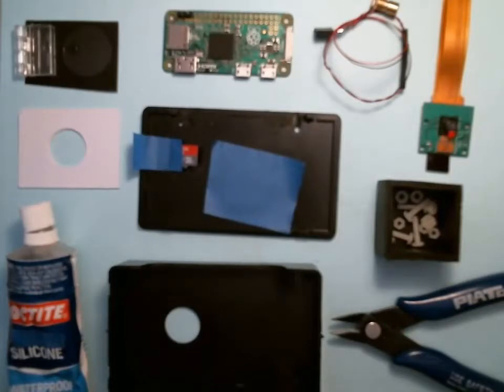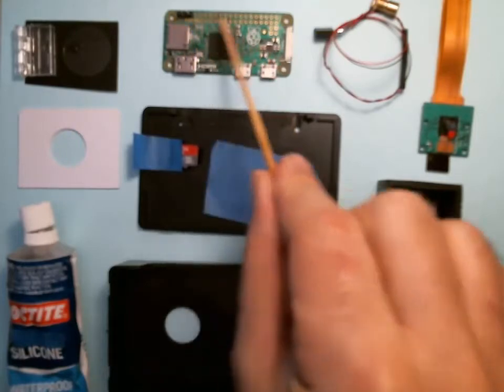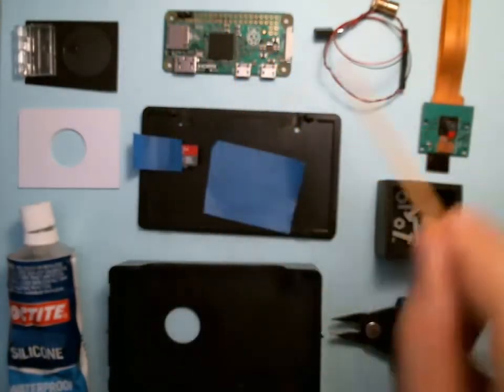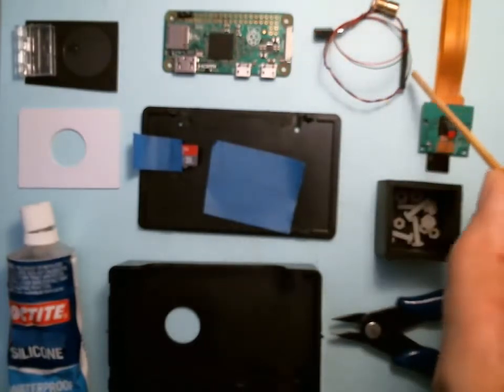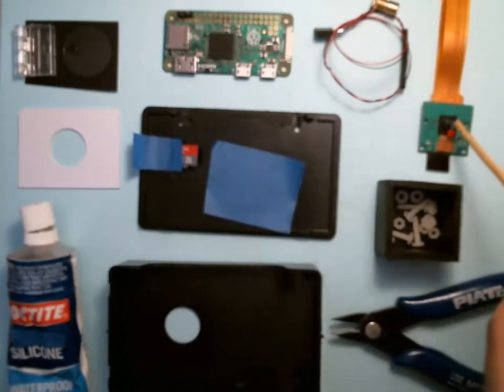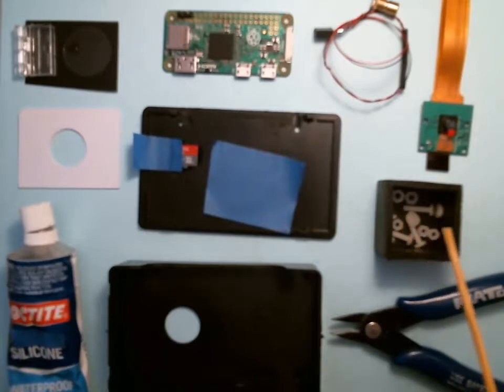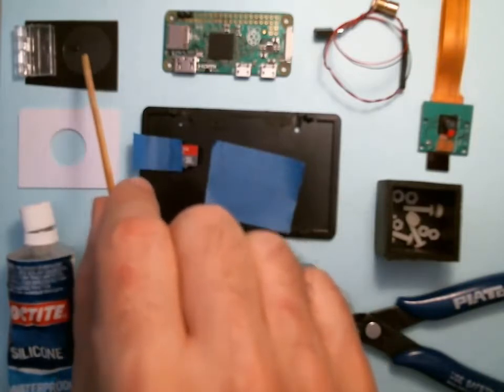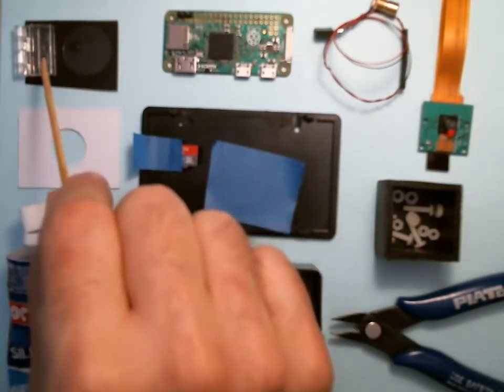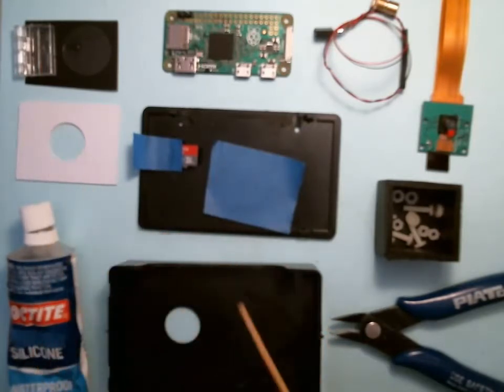First step, let's take account of our inventory. We have the microprocessor board with some headers connected — I only have three, you might have more. We have the laser assembly: that's the laser, that's the connector, and in this black tube is a resistor with shrink tubing. We have the camera with the lens on it. We've got the black cap, and in there are four bolts and eight nuts.